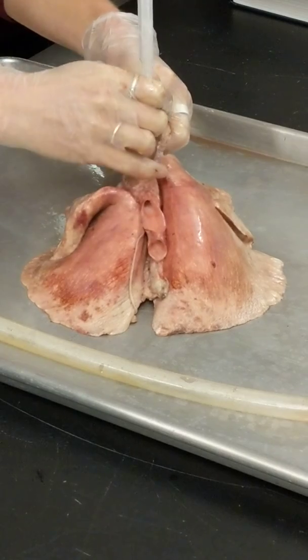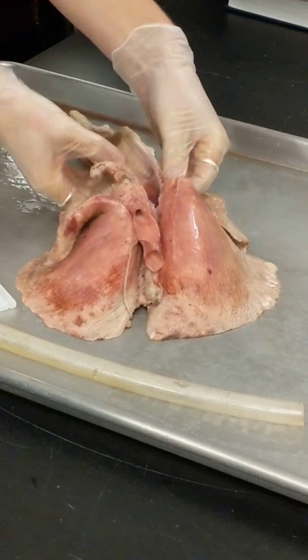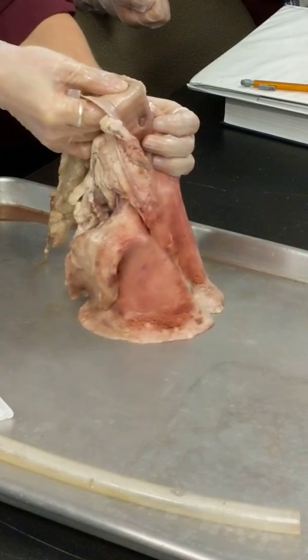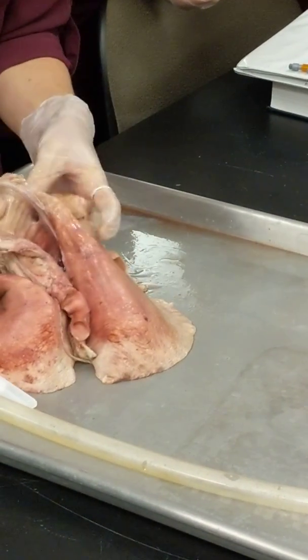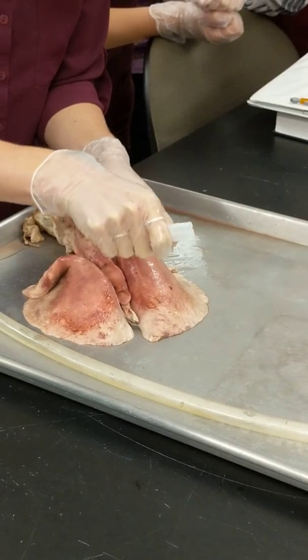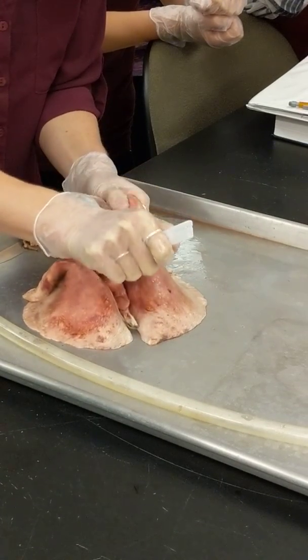So the trachea goes down and it has to split into a right and left bronchus, but you have some accessory bronchioles. Do you guys see the little hole right there branching off of the trachea? Mm-hmm. Yeah, kind of neat. So that's a little accessory that's coming up to probably this lobe up here. And let me do one more little cut down the right and the left.